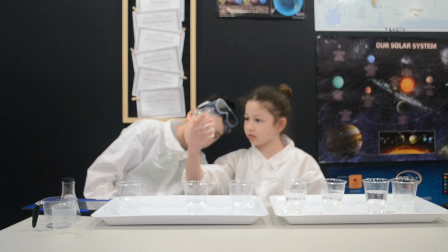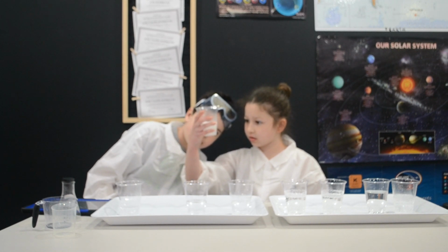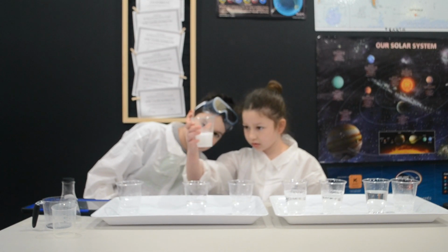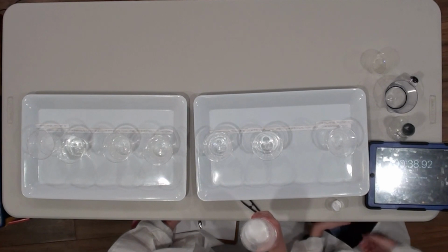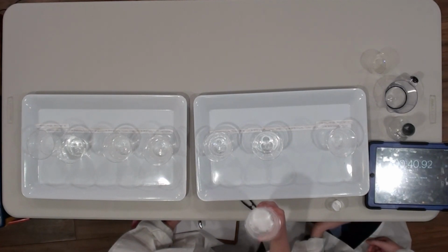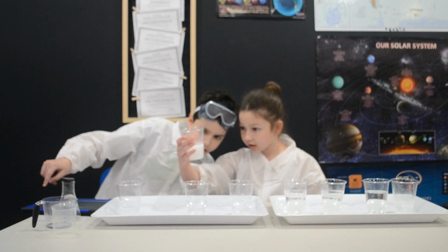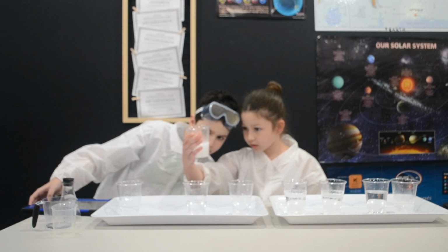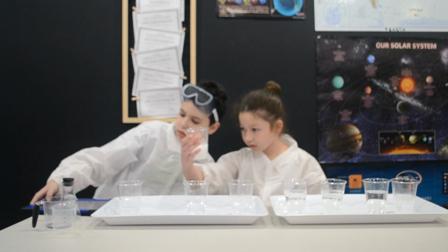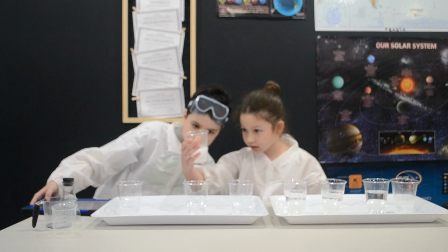It's almost done. Where is it? It's right there. I see it. Oh, I see it too. I have to follow it. It's right there. It's pretty obvious to see it now. No, it's not done. Yeah, I know. I'm just getting ready. It's almost done. And it's done.